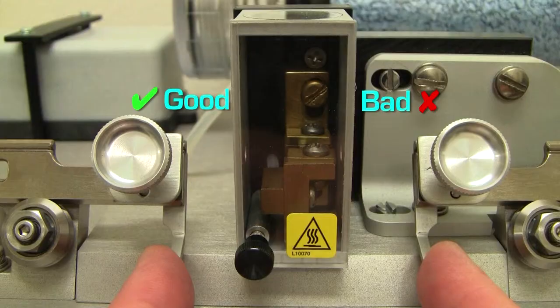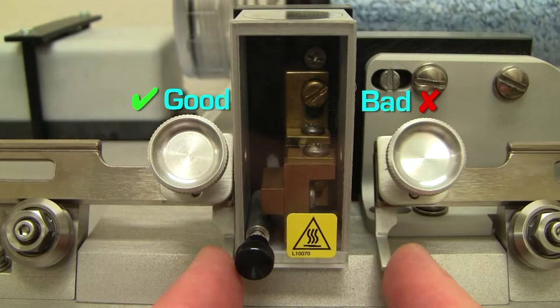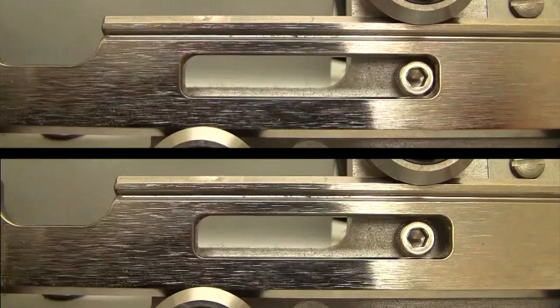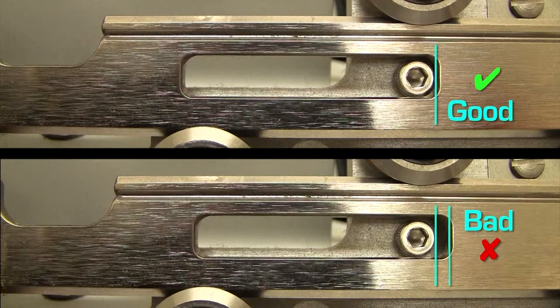Under no circumstances at all must the pull cables be under tension. If you cannot pull the puller bars together until they sit against the hex screw in the slotted hole, call Sutter tech support immediately.